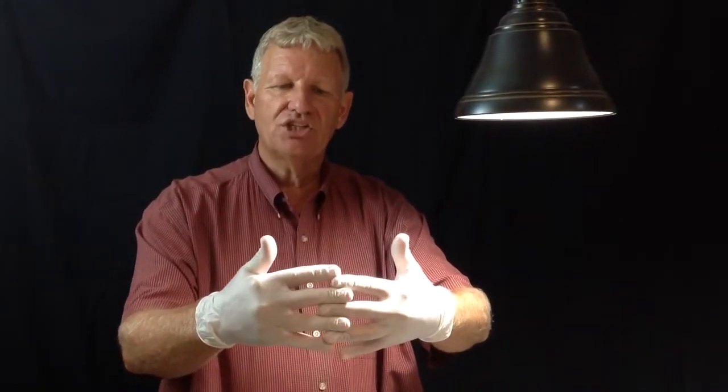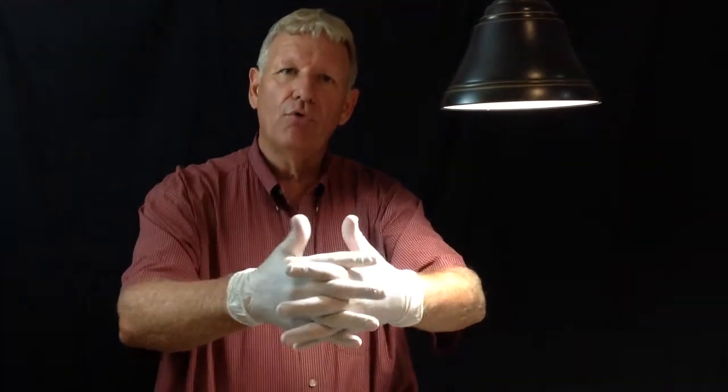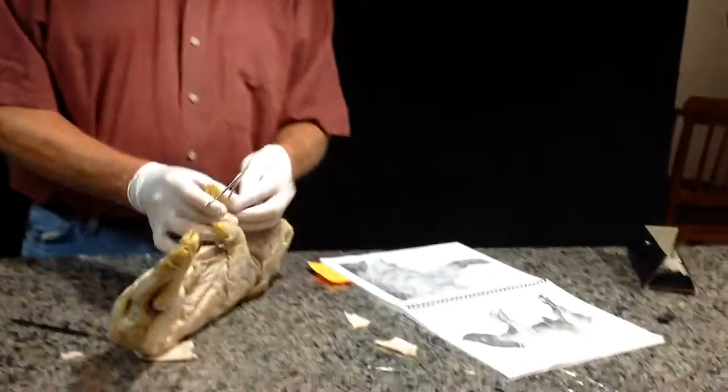Now, this is a strained or pulled muscle, and this is a torn muscle. So it's a gliding action that allows those muscles to work and to support energy for moving the skeletal system or whatever they're going to use those muscles for. So I wanted to show you some of the fibers there. Now let's get inside this pig.